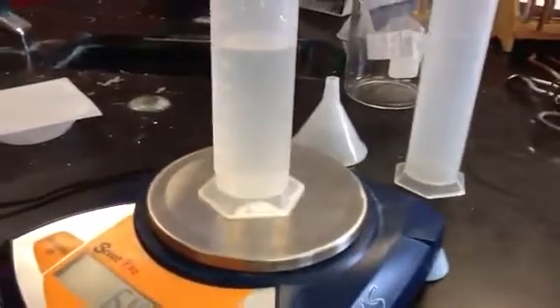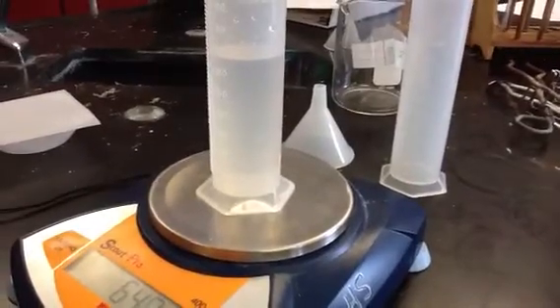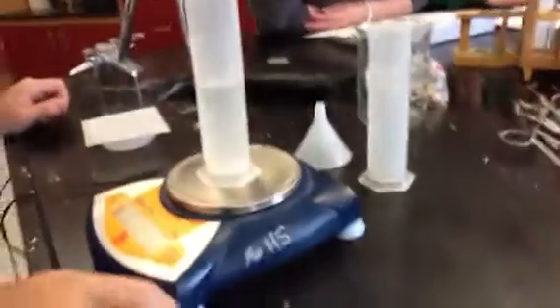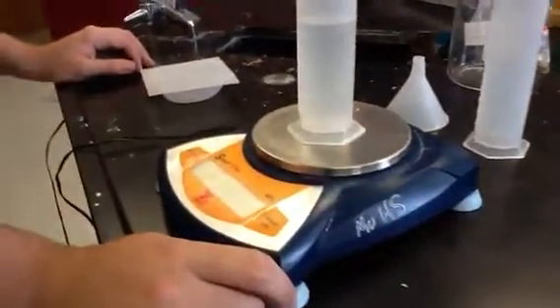And what do you think the volume looks like? About 67. It's hard to tell because of the plastic. The plastic are harder to read, which is why they're not as accurate. Nice.